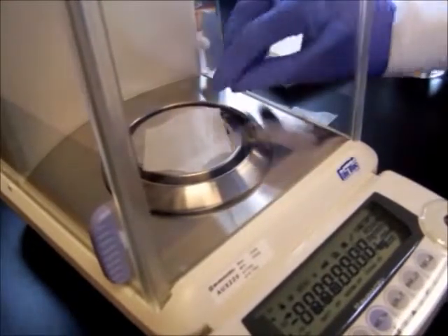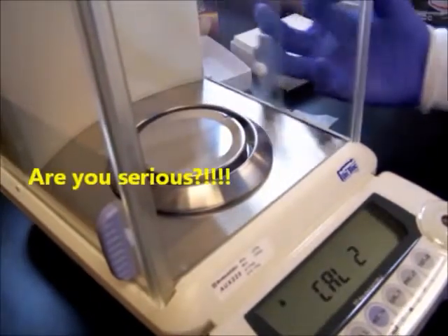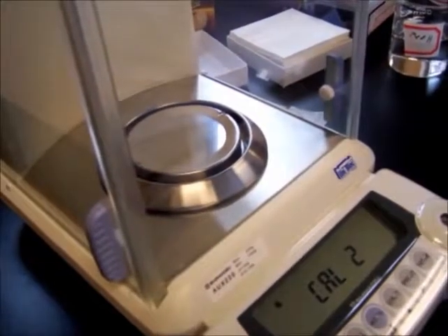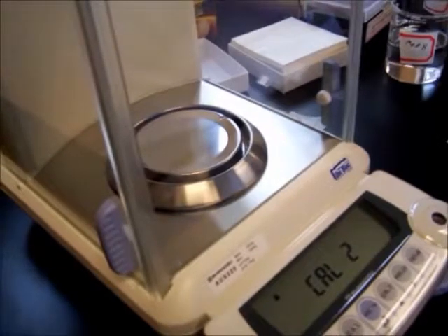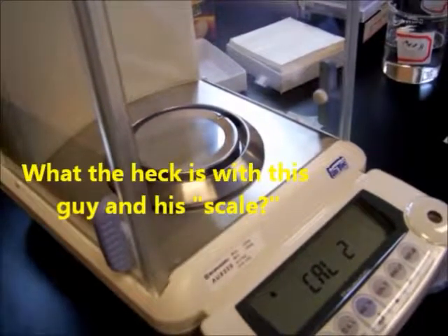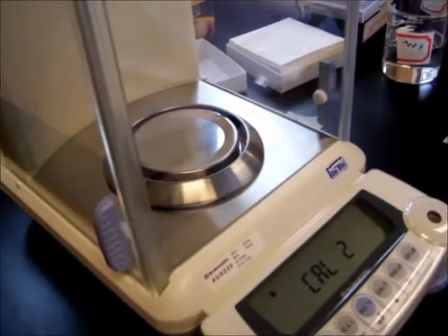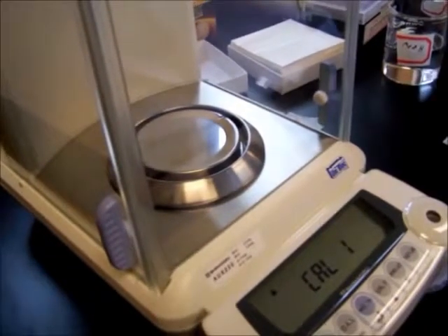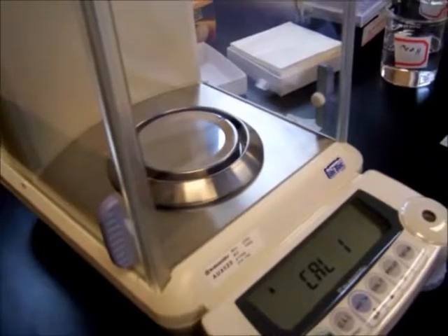Oh shoot, gotta pull that out. The scale self-calibrates, so make sure nothing's on the scale as it's calibrating. Also, try not to touch the table as the scale is calibrating. Touching the table or any sudden movements can throw off the calibration. Still calibrating.